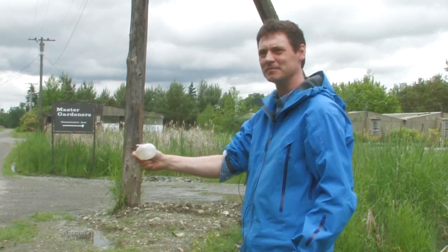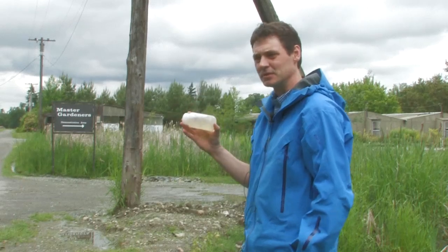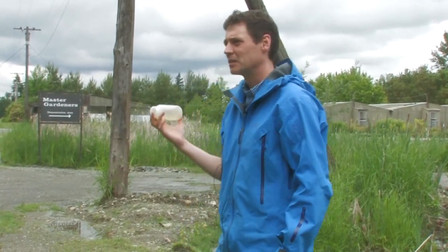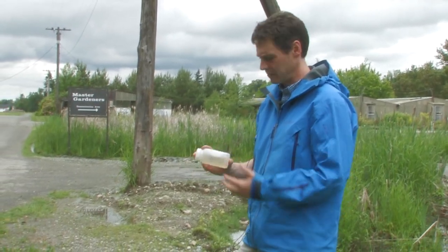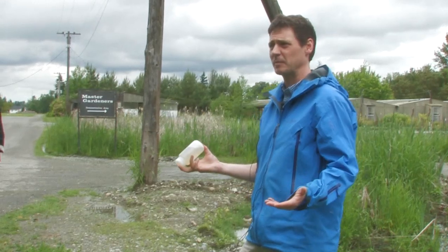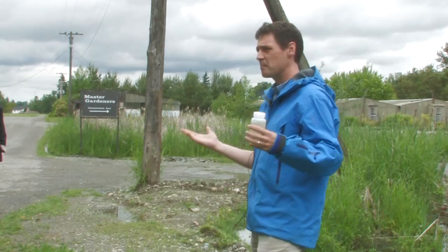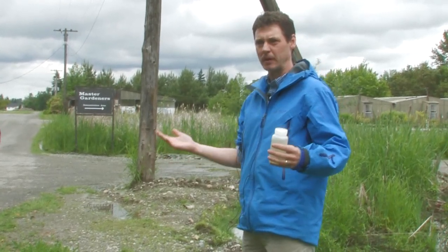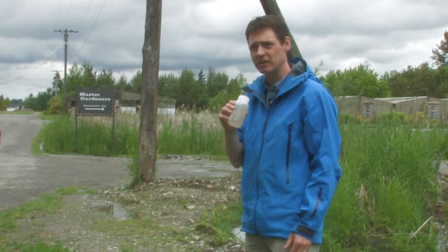I'm fired. Why am I fired? My finger was in it. What else did I do wrong? Stirred up the sediment. My bottle is contaminated — I've been using it to water my plants, I even put some plant food in here. I didn't check with the lab to see what type of bottle I needed. The cap I just threw on the ground. I am one of the biggest sources of contamination for this sample, so I need to protect the sample from me. No gloves. I was breathing over the sample when I was checking it, after messing up the actual in-water sampling.